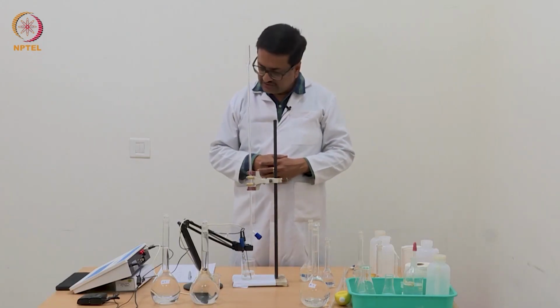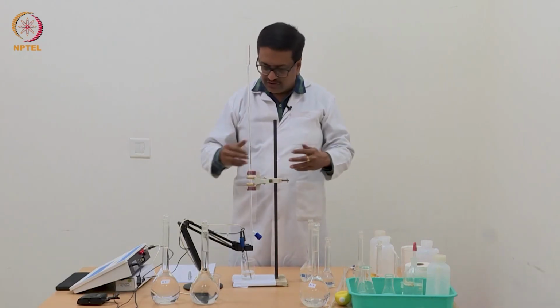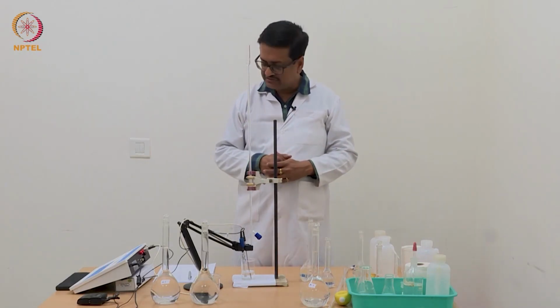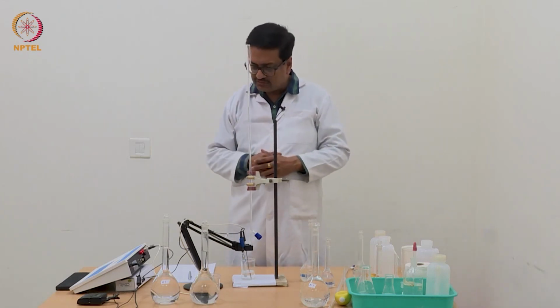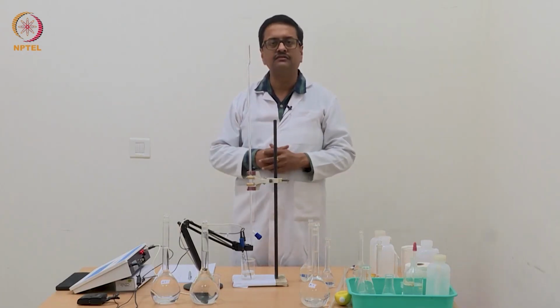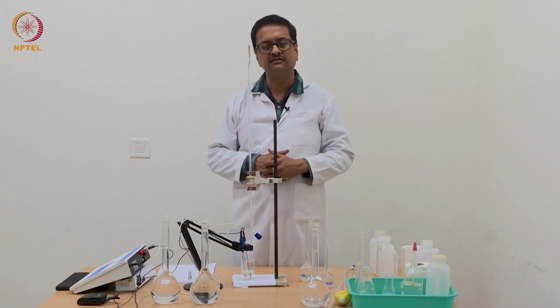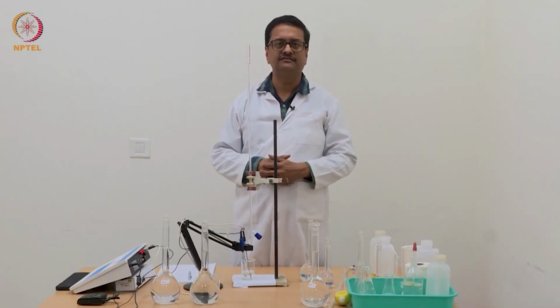So with this we end first part of our experimental discussion using potentiometric titration. This will be followed by the calculations, graphs of these experiments, and we will conclude the week with those data. And in the next week we will have experiments related to conductometry and conductometric titrations. Thank you.